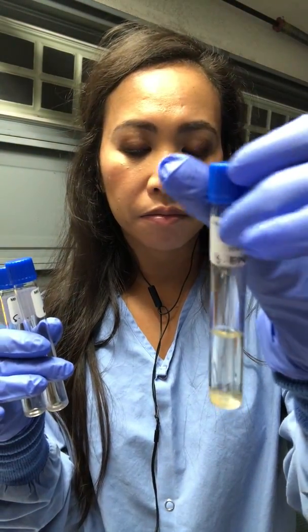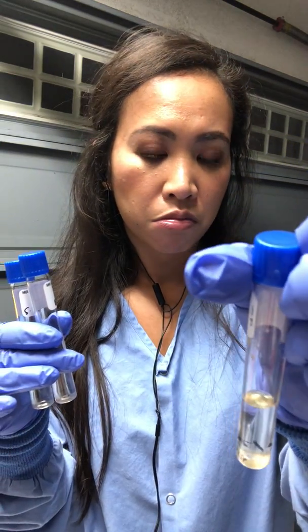And for the first one with the Methyl Red, we were asked to do an experiment using the MRVP broth that were thawed out. These broth were inoculated originally with different bacteria that were asked, and those were the E. coli and the S. epidermidis from the nutrient broth that were made in the past, in the beginning of this semester, which was November 7th. And these were inoculated as such, and it was incubated for 48 hours.